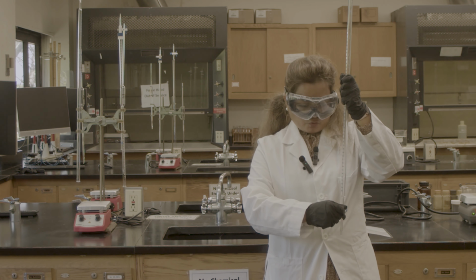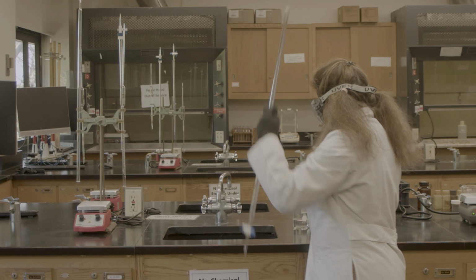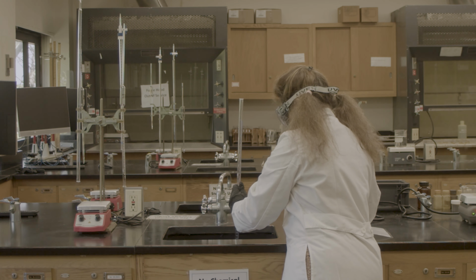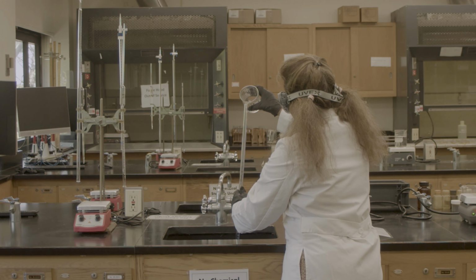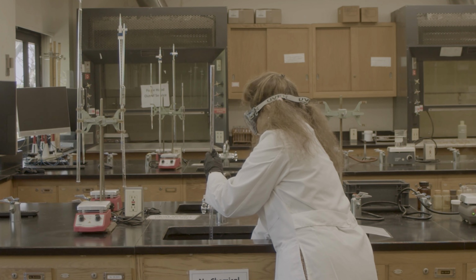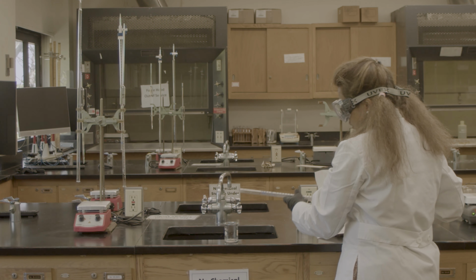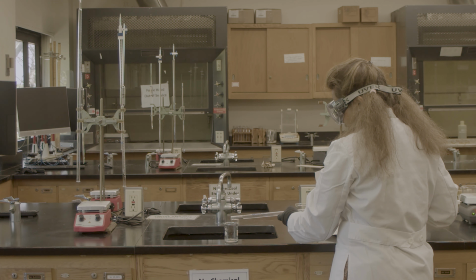Before I neutralize it, I should close it. Remember, nothing is going to go into the sink, so I use my waste container. I took a little bit of my sodium hydroxide, up to like 5 milliliter. As this portion is open, I just keep it like this so that nothing is going to spill.